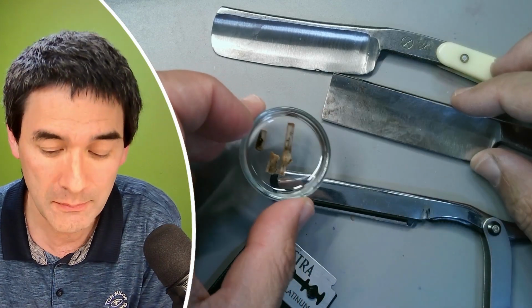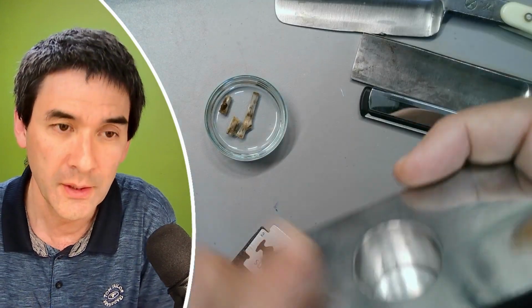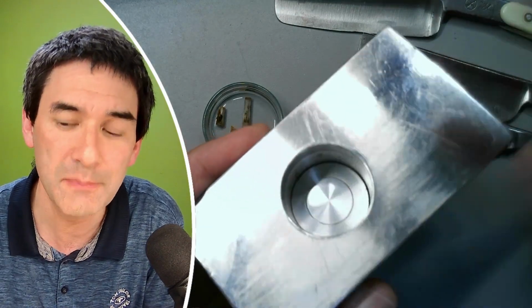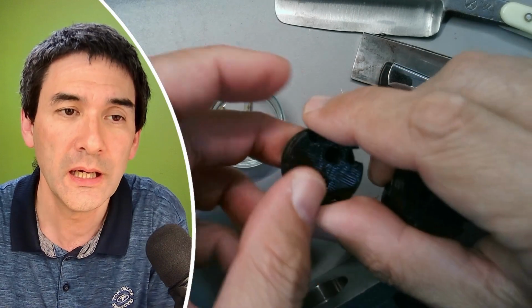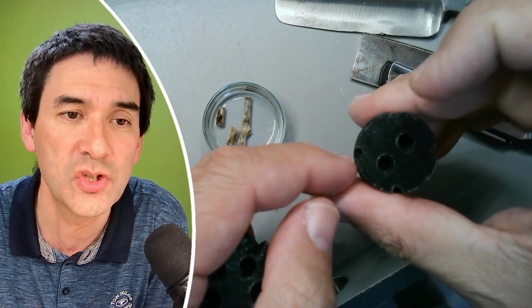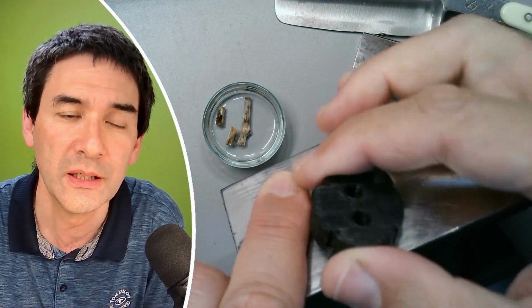Okay, so which Microtome will I be using? I've got one over here. This one is the Microtome that I'll be using. You can see you can put it over here into a table, and in here this is the specimen holder, and I also 3D printed a couple of specimen holders here. It will become clear very quickly how they're going to be used, because the piece of wood will be inserted into one of those holders over here, and then the whole thing goes into the Microtome.